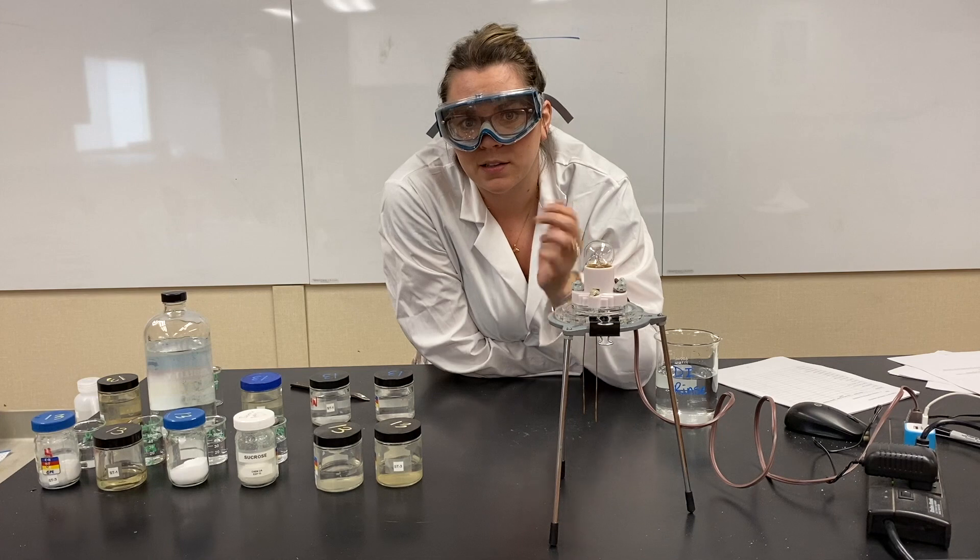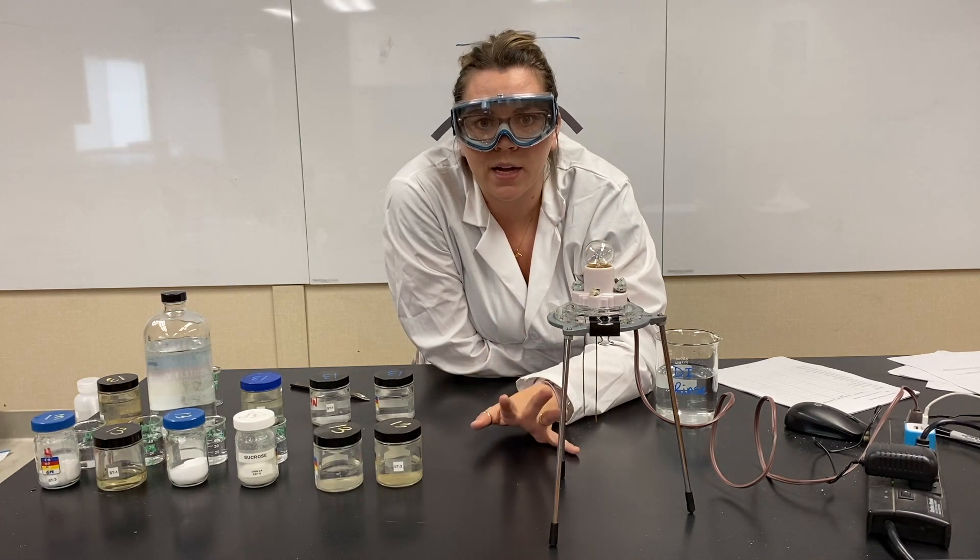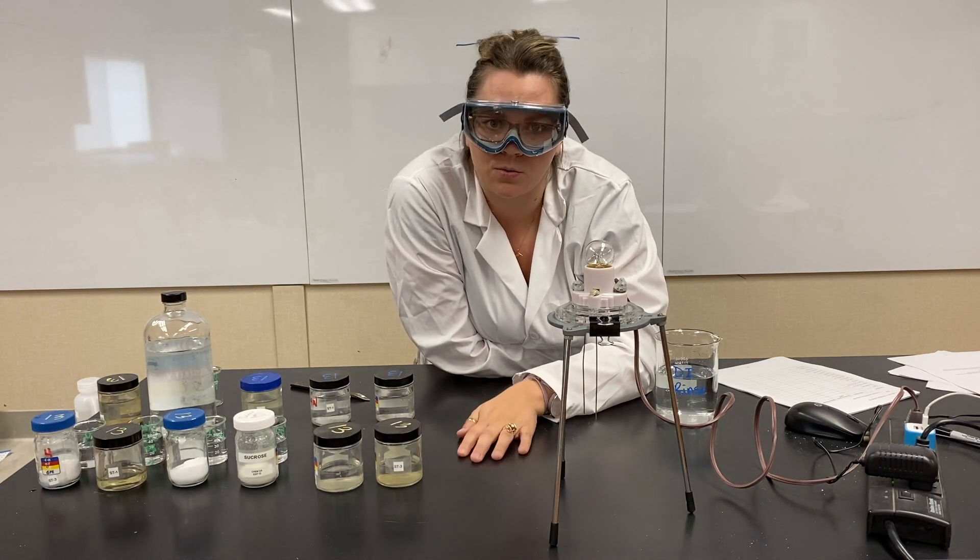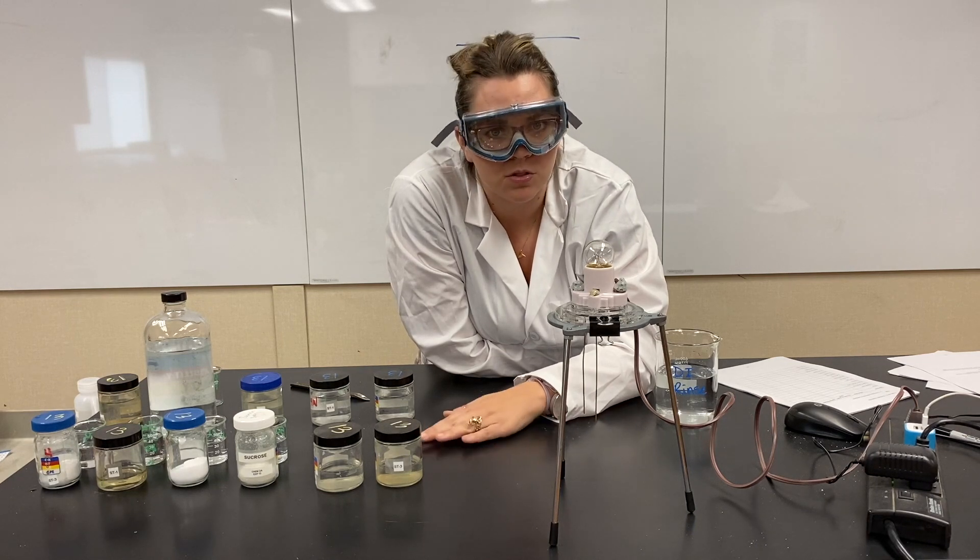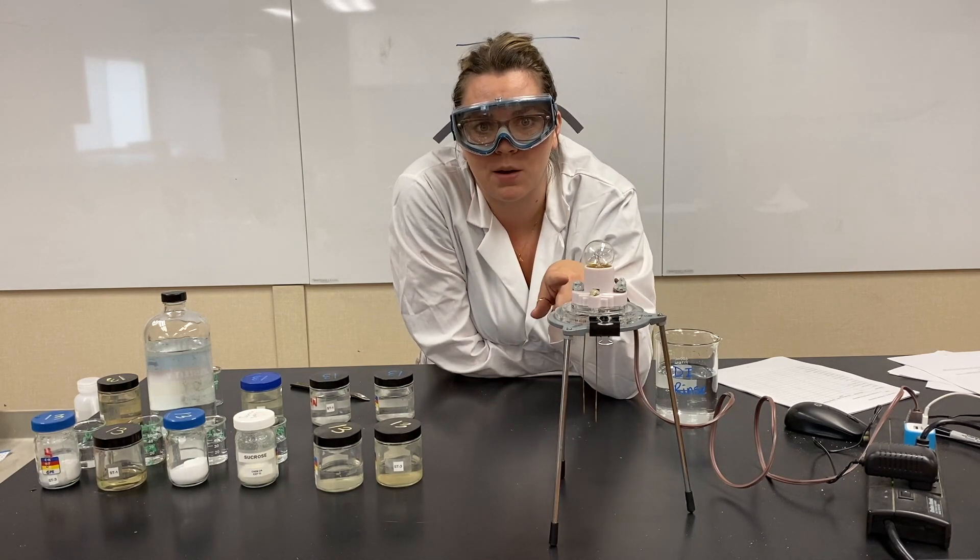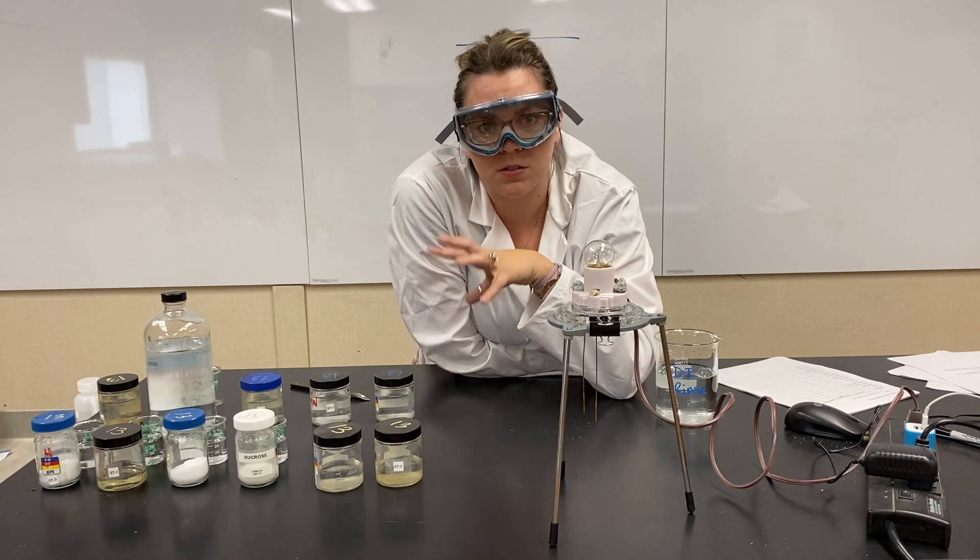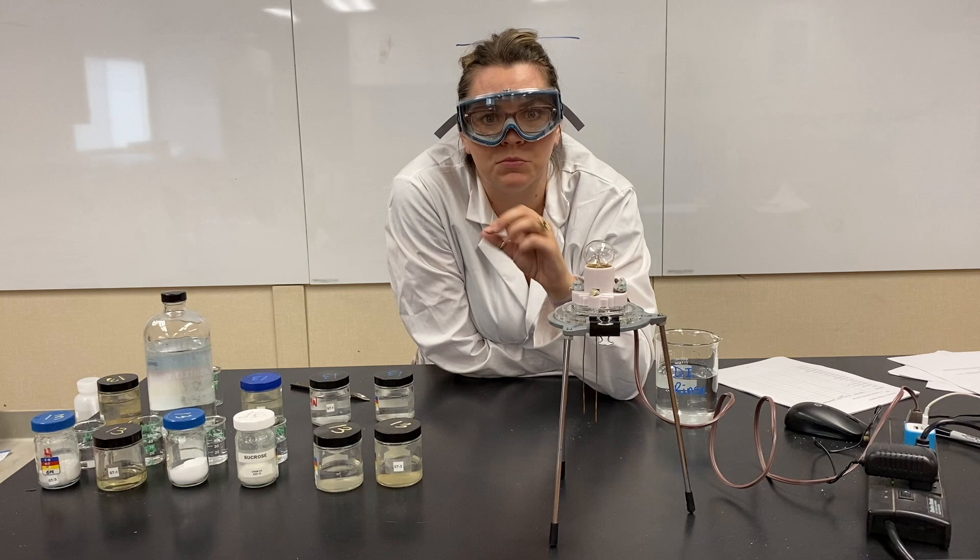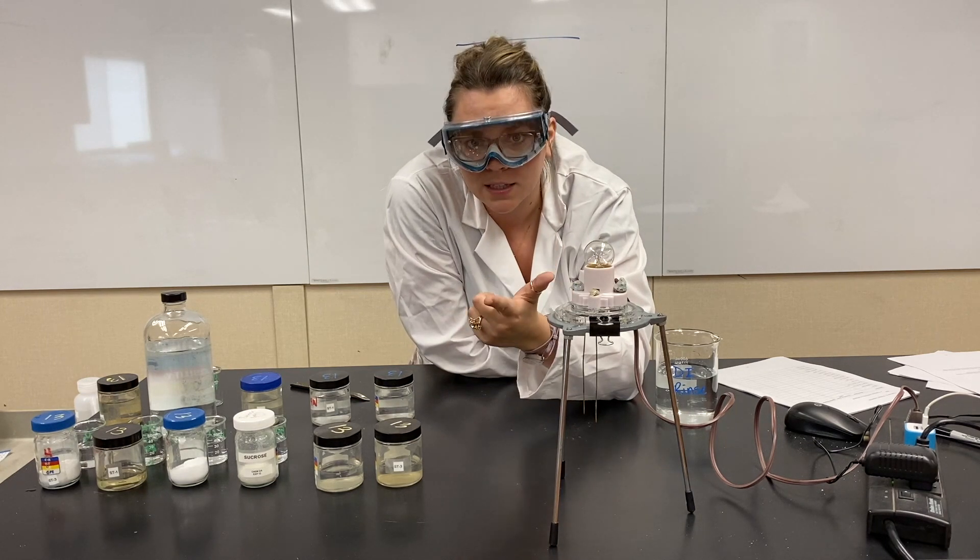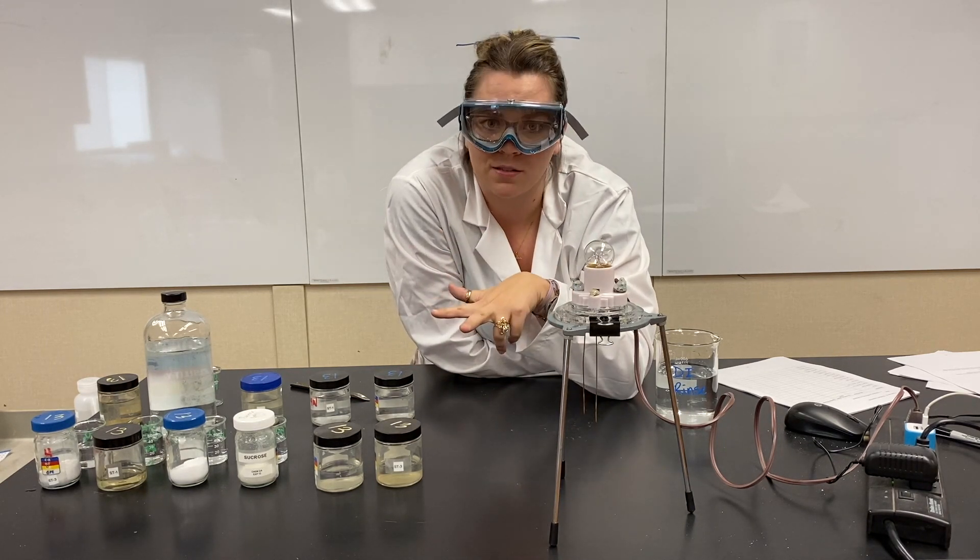If the water in that bathtub was DI water, deionized water, there's no ions in the water. It's deionized water. Nothing would have happened. There's no electricity that's going to be conducted through that water, through that solution. But we have a ton of different solutions to check and see if they are strong electrolytes, weak electrolytes, or non-electrolytes.